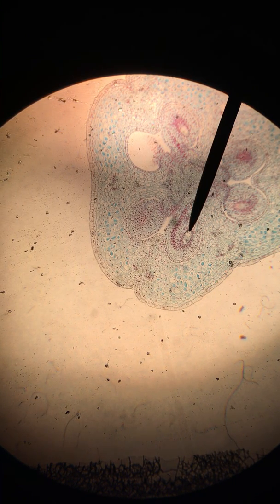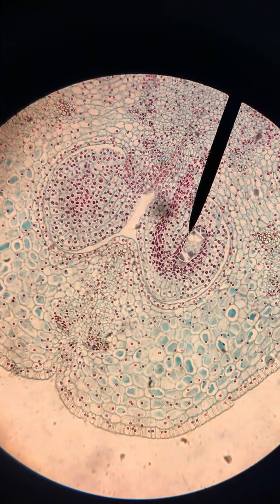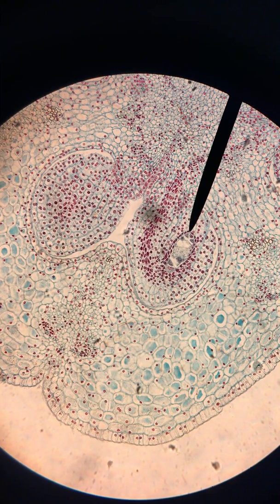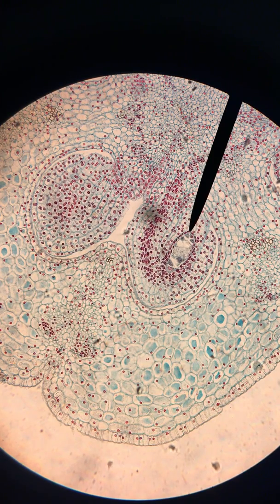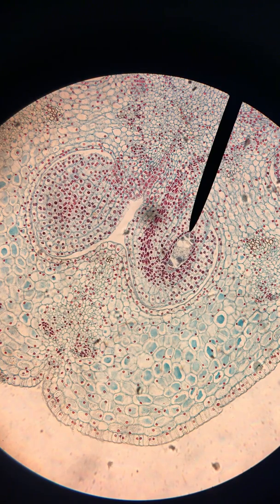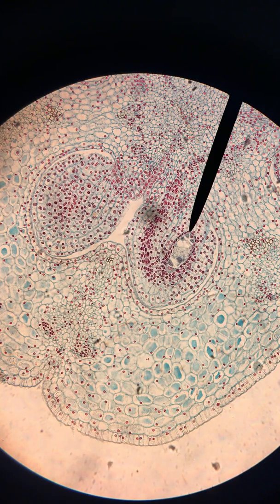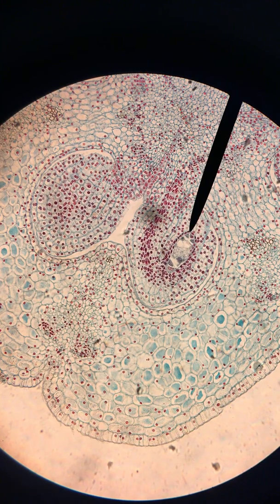In order to see that more clearly, we are going to increase our magnification. The last time I recorded slide 7, I mentioned that the embryo sac was undergoing mitotic divisions. The one cell that had been our mega spore had undergone two divisions already, producing four nuclei, and had yet to undergo one more mitotic division producing eight nuclei.